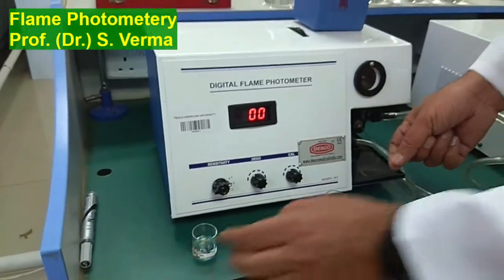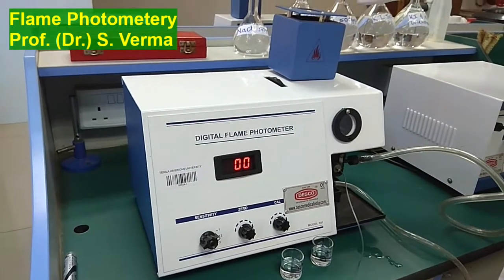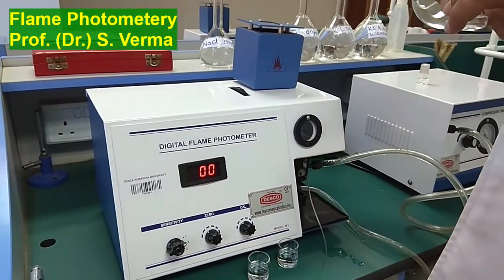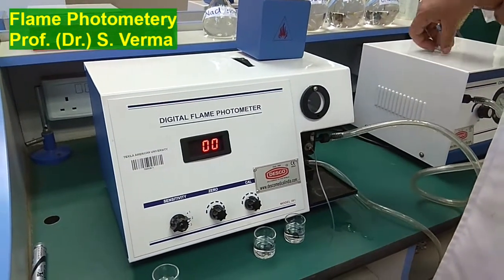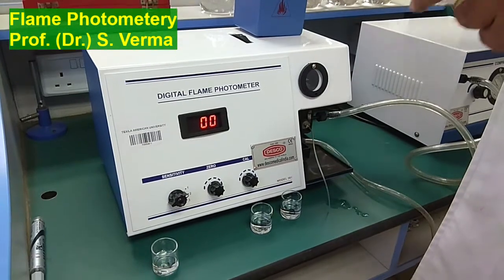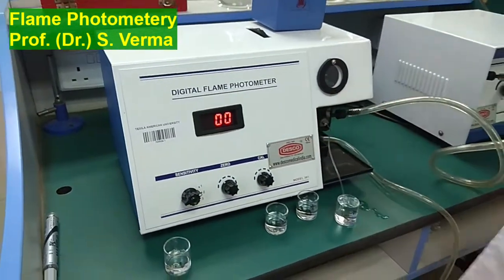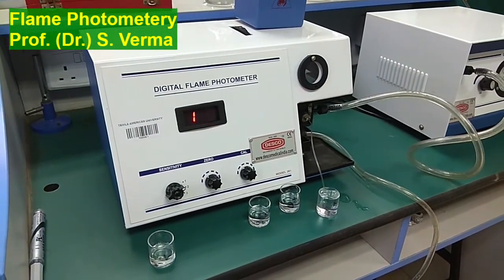So I'll take this tube out and dip it in a standard potassium solution. I have 50 ppm standard potassium solution with me. So I'll be using that solution and my instrument should read it 50. If it's not reading, we have to calibrate it. That's the step I'm doing basically, the calibration of the instrument. So I'm dipping the potassium solution and you see it's reading too high.